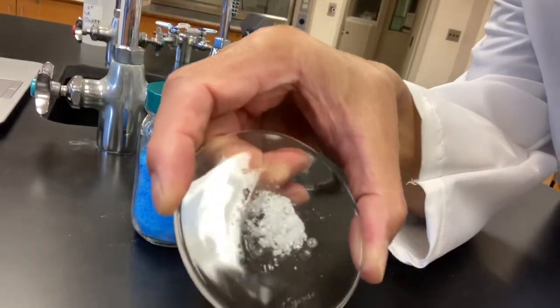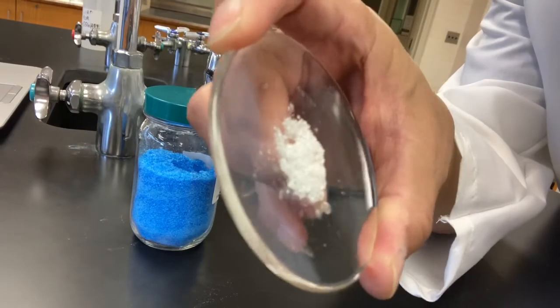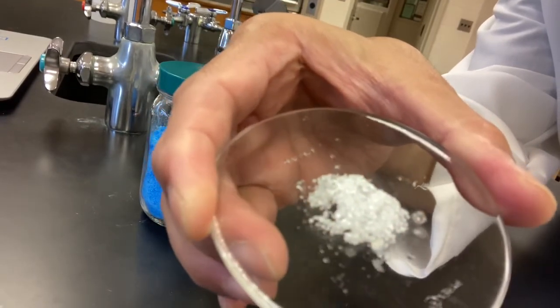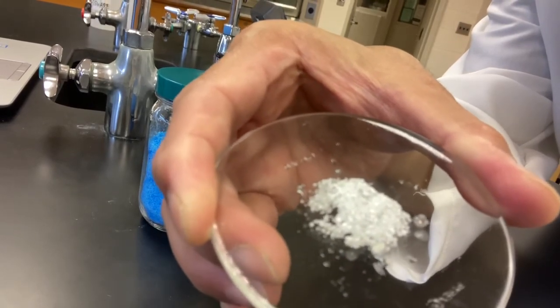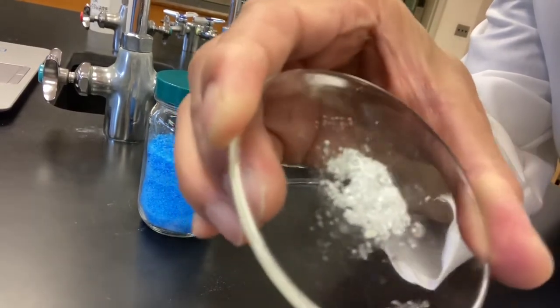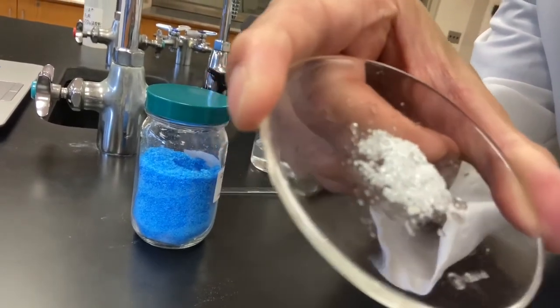This is the sample. It cannot flow anymore. I can barely call it powder. They got stuck onto the glass and they cannot move at all. And if you watch closely, you might be able to observe some water droplets around it. You need to record all these observations. Whatever you see, the state or the appearance of the sample right now, you need to record it down. To me, they got stuck together, they cannot flow anymore, and we see water droplets around the sample.